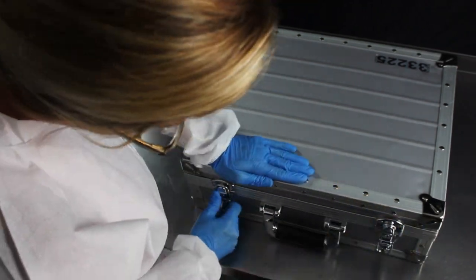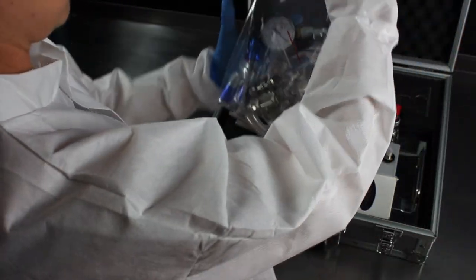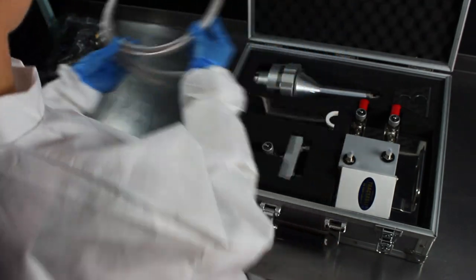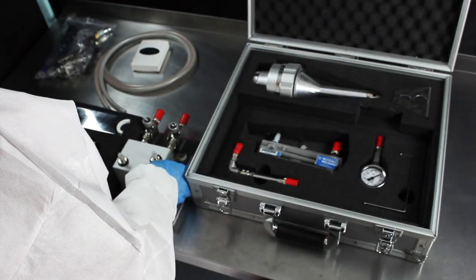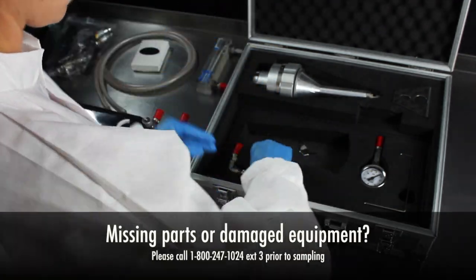Let's assemble the Pinocchio Super 2 so you can sample your compressed air or gas for microorganisms. After you've inspected the contact plates, unpack the Pinocchio case and make sure you have all the necessary parts.